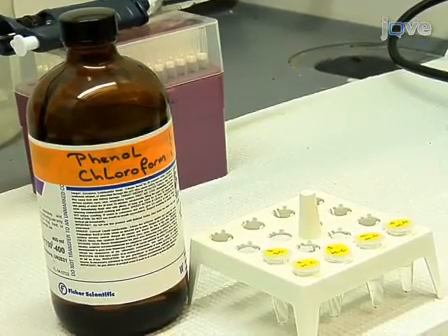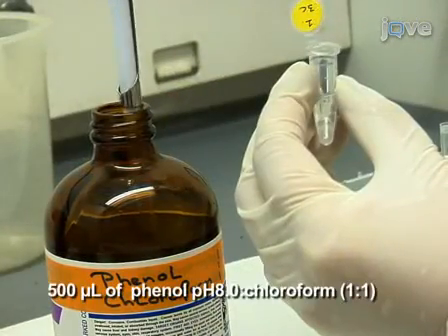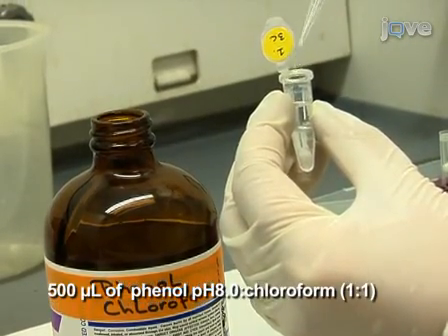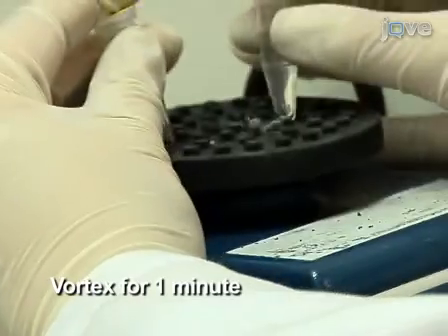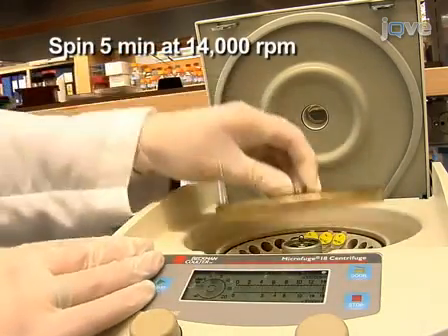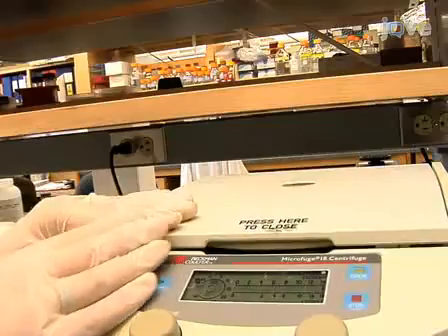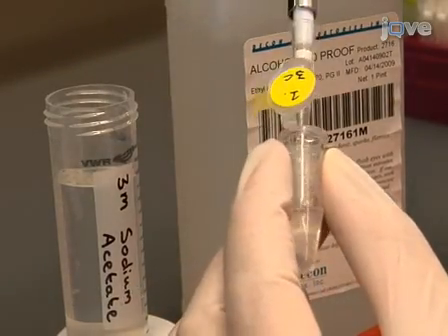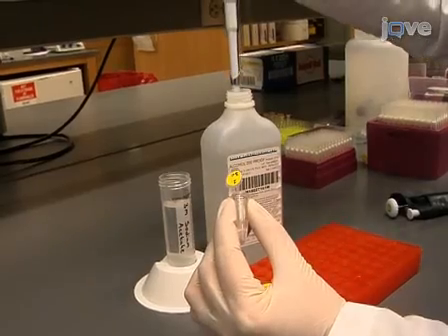Another round of purification is performed by doing 2 phenol chloroform extractions. Add 500 microliters of phenol chloroform and vortex for 1 minute. Centrifuge the tubes for 5 minutes at 14,000 RPM and transfer the aqueous phase to a new tube. After the second extraction, the DNA is ethanol precipitated.